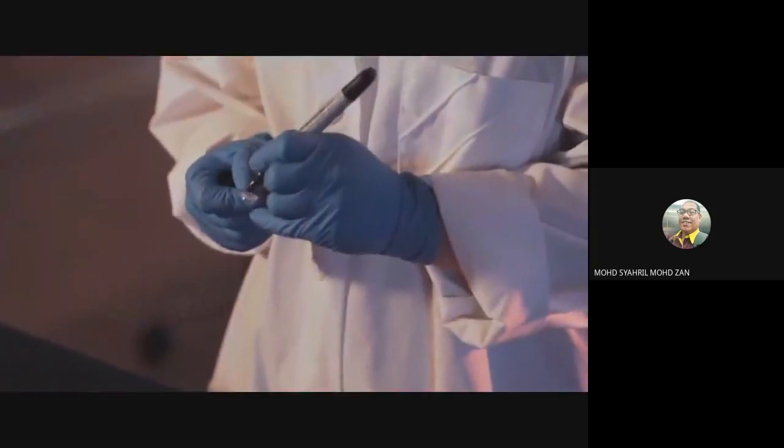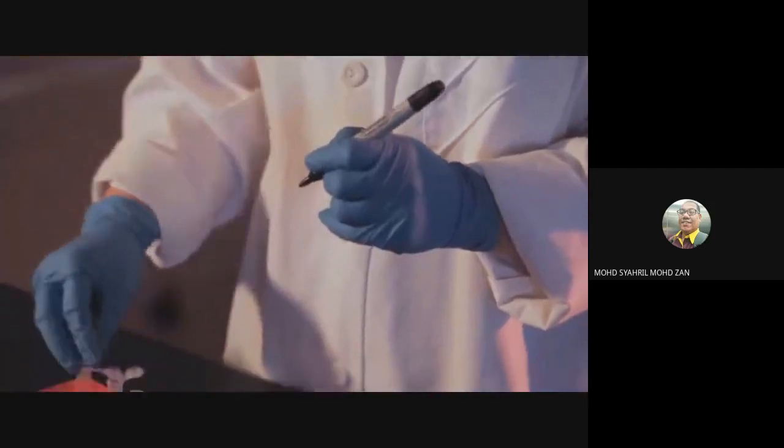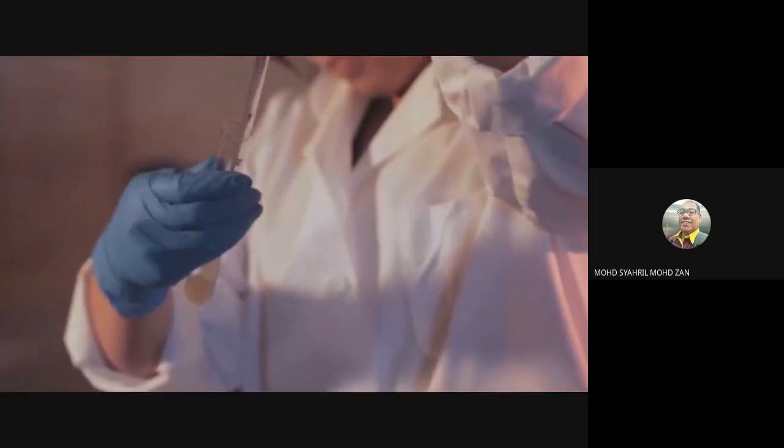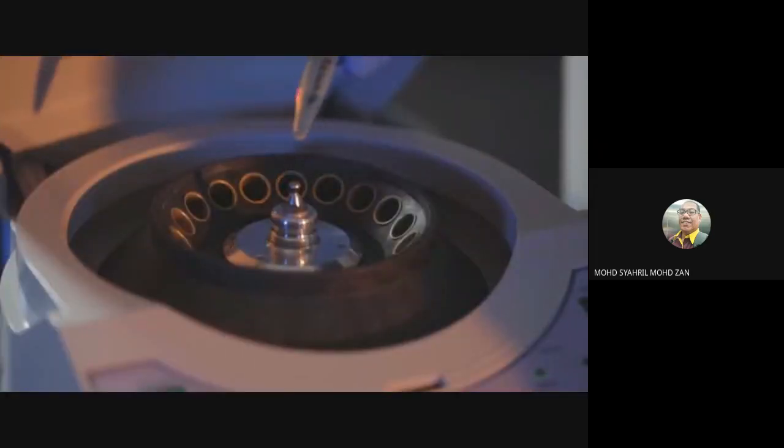Label the 1.5 milliliter microfuge tubes you will need. You will label 1 tube per culture. Using sterile 5 milliliter pipettes, pipette 1.5 milliliters of each culture into the appropriate labeled microfuge tube. Use a fresh pipette for each culture to avoid contamination. You will now harvest the bacterial cells from the culture by centrifugation.